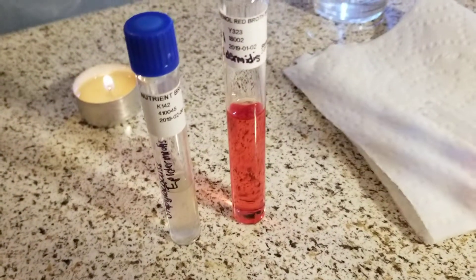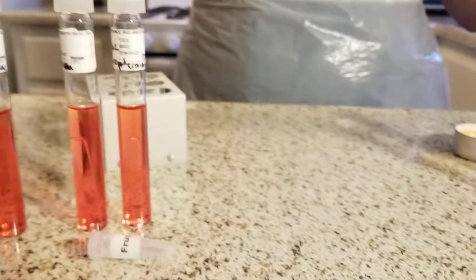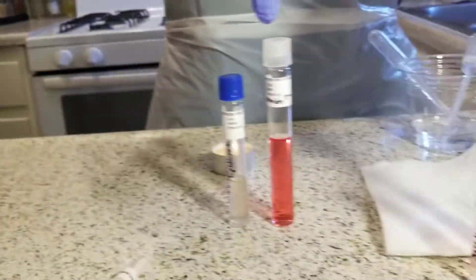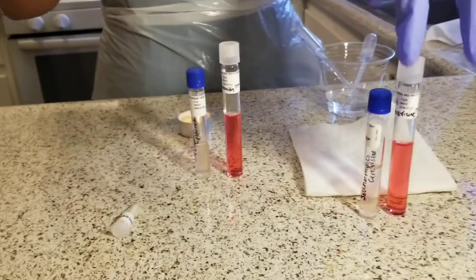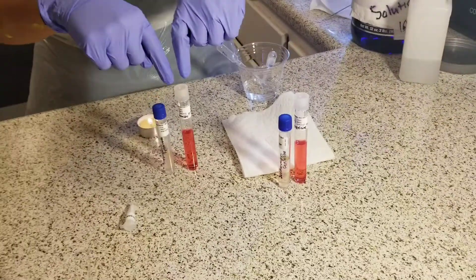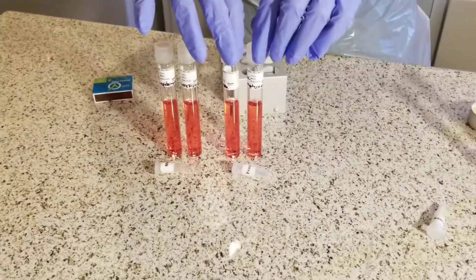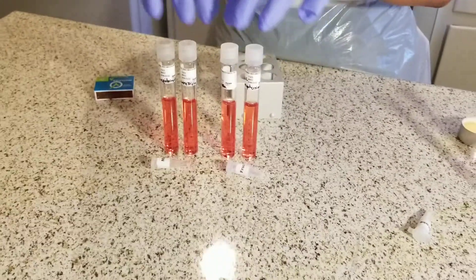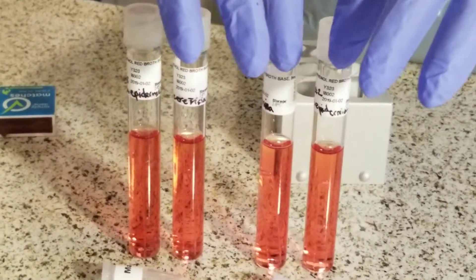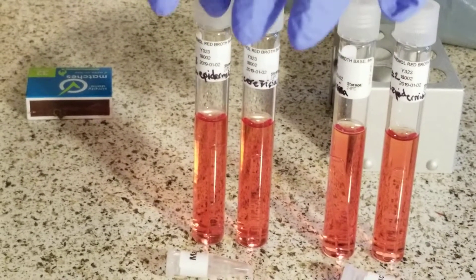As you can see, I've already labeled all 6 of my phenol red vials, which are these ones right here. Number 1 is glucose — one is going to be with the S. cerevisiae and one is going to be with the S. epidermidis. Then I have the number 2 vials right here, which I've already completed, as well as the third tube. The second one is going to be fructose, and then the third one is going to be mannitol.